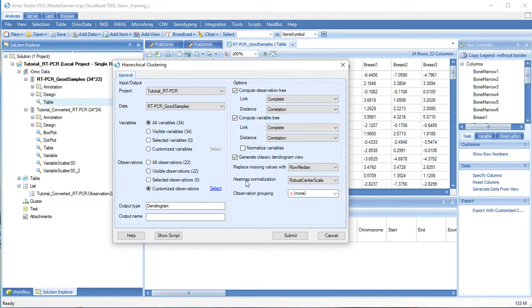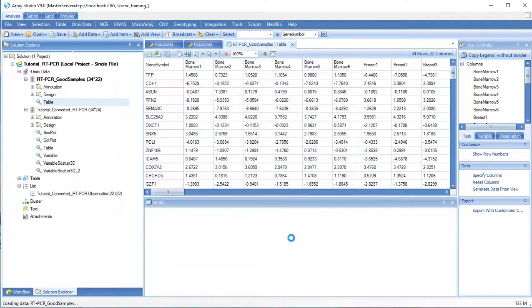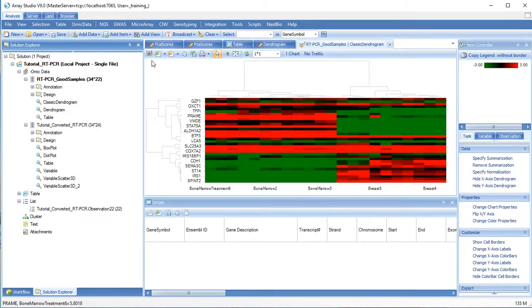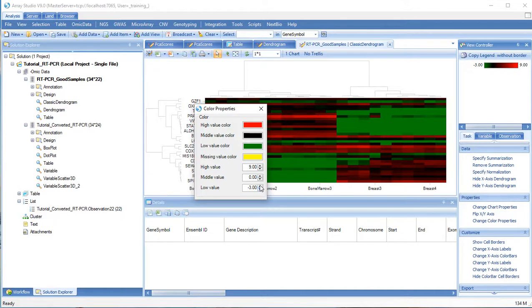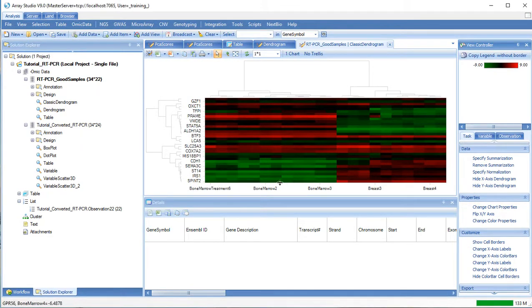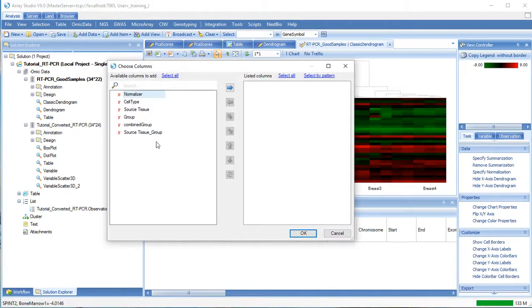For this example, we won't normalize the heat map. However, we will increase the scale. Right-click and choose Change Color. We can add a color bar to easily see which sample group each of these samples belongs to. Let's add source tissue and group.